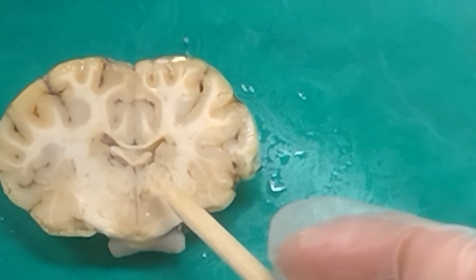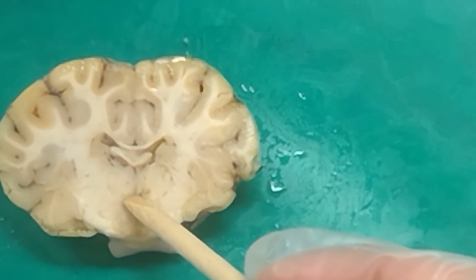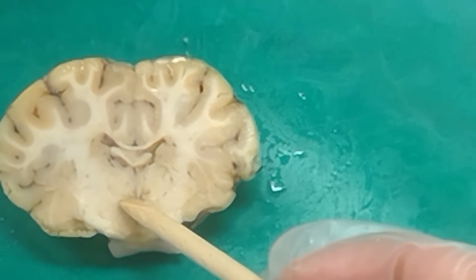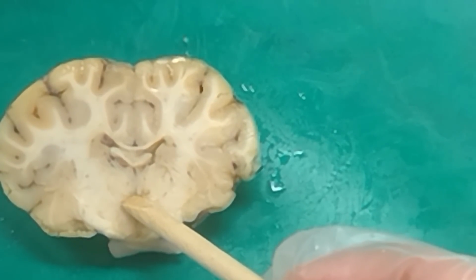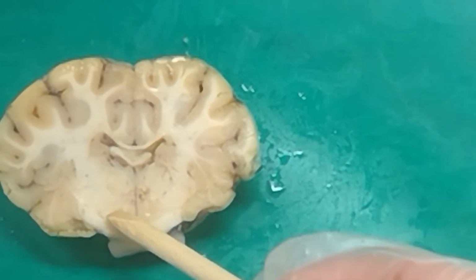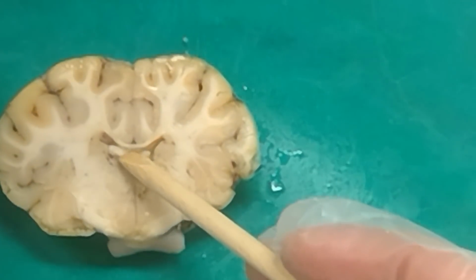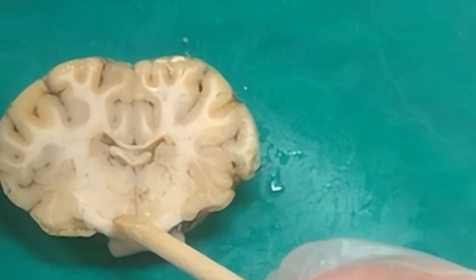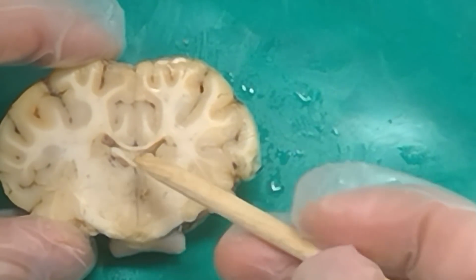All right, so from this cut, we can kind of see this dot pattern where you've got a dot up here and a dot down here. So you guys are going to just kind of have to use your imagination a little bit here. But what are the dots that, if we're putting a pin here and there's dots up here and there's dots down here, what are the dots that would be just dorsal of the pin, so the higher ones here? Right, and the ones that are just below that? Cool, yeah. So you've got the fornix that basically is up here. It curves around the thalamus, and we see these columns of the fornix coming down right here. Yeah, so that's the fornix.